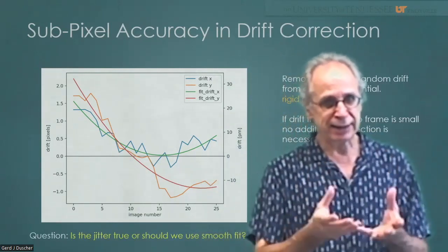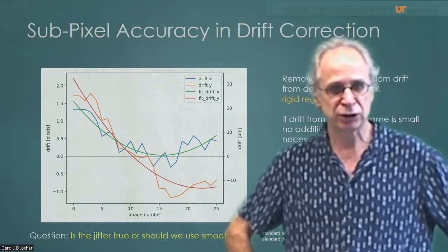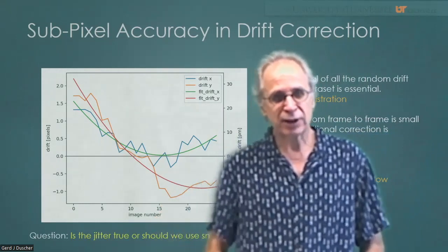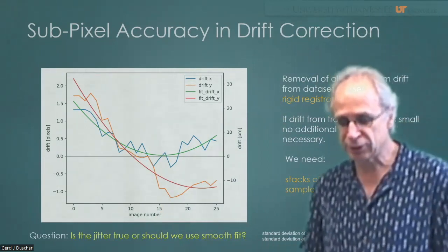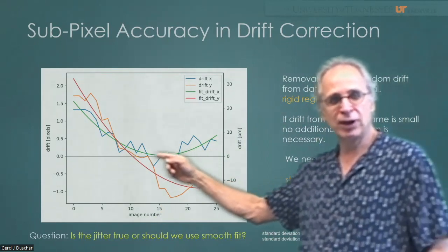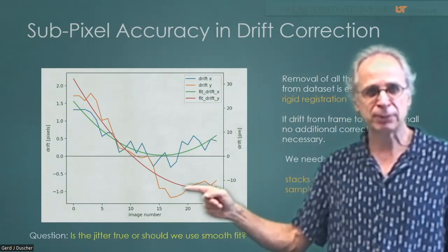So if you have a stack of images, you can make a rigid registration. In the end, it is a cross correlation from one image to the next, and then you can determine how much of a drift you had. This is one of the stacks I acquired. Actually, this one was acquired by Matt Chisholm. And you can see now what kind of drift we got in the X and in the Y direction, right? So that is the X, this is the Y.